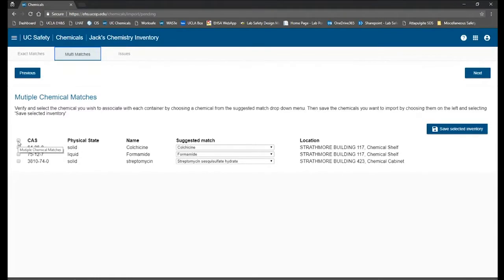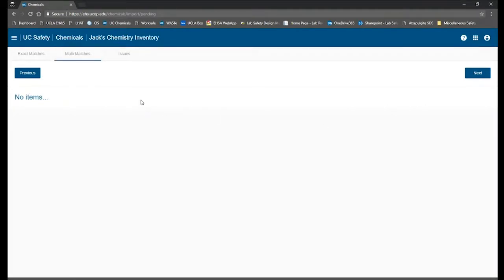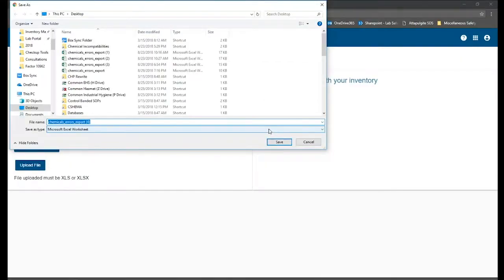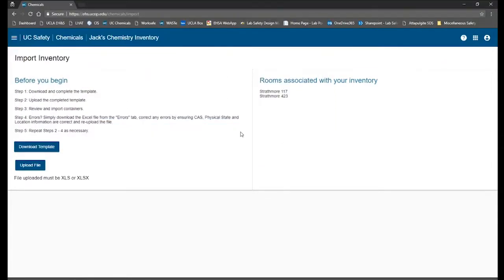I'm going to click them all, save the selected inventory, look at any issues. I have 0 invalid items, and I'm going to complete the import. Now, it may download another file. You don't actually have to save it. I cancel that. I'm going to go back into my inventory summary just to check.